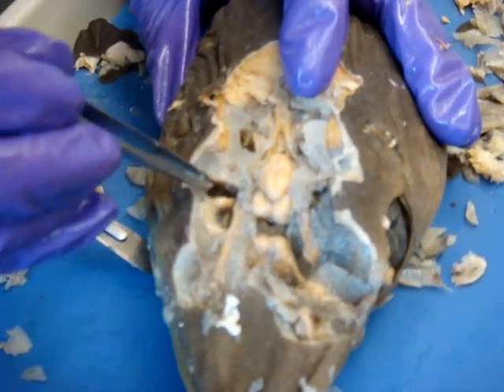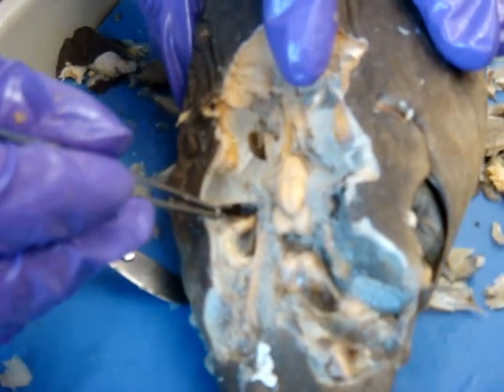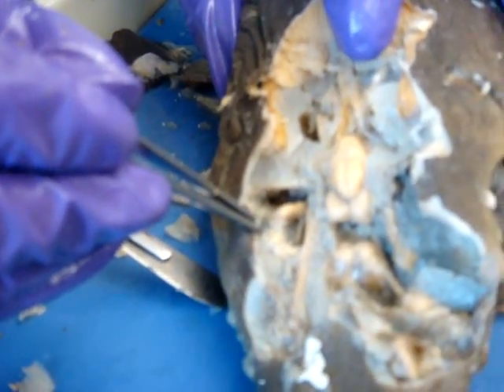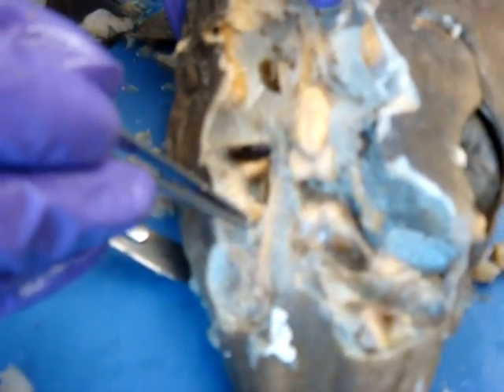There are 3 rectus muscles that all kind of originate from the same place. One comes here laterally, and that's the lateral rectus. One comes up here, and is the dorsal rectus. And one goes up front, and it's right here, and that's the anterior rectus. There's one dorsal muscle that comes from a different direction, and it is the dorsal oblique.